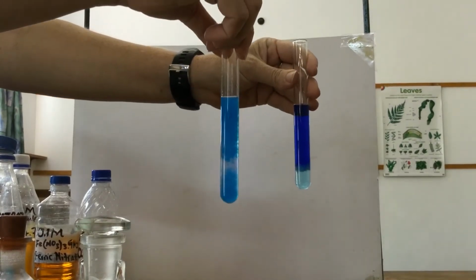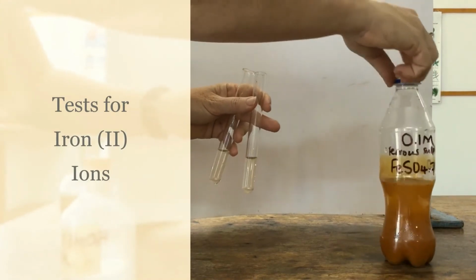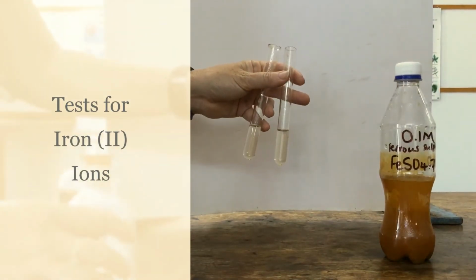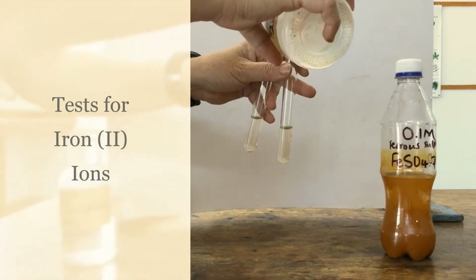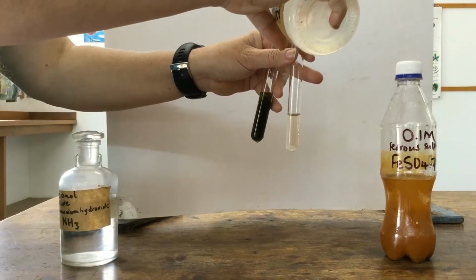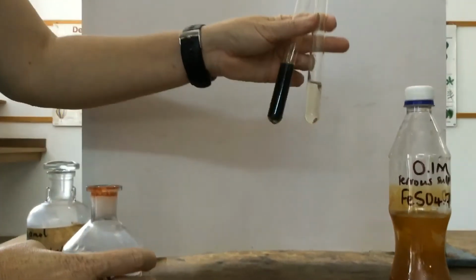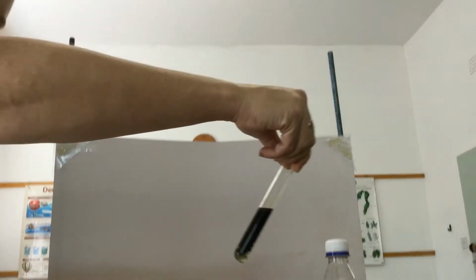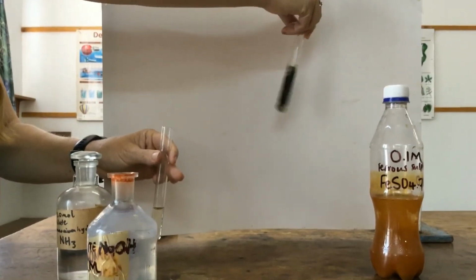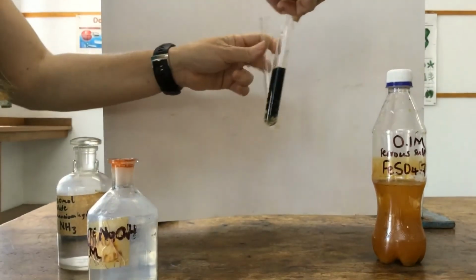Copper with sodium hydroxide, copper with ammonium hydroxide. In this one, we've got iron 2 sulfate, so we've got Fe2 plus ions. We're going to add sodium hydroxide to the first test tube, and what we see is a very dark green gelatinous precipitate. If you look carefully at the bottom, maybe you can see the green color. It probably almost looks black. It's like a licorice green.